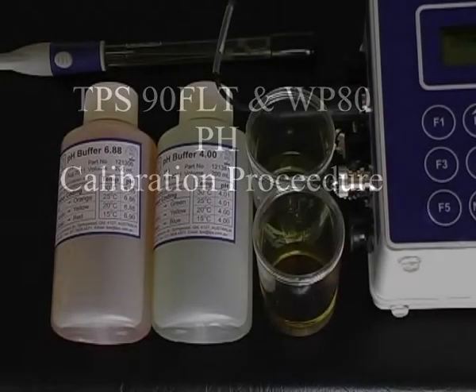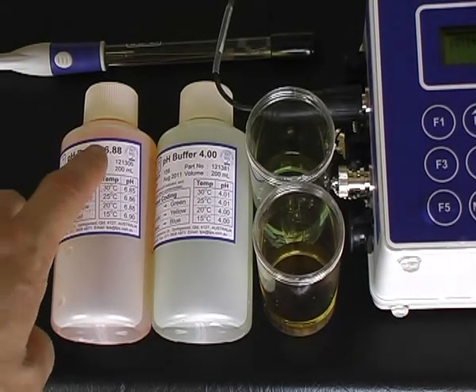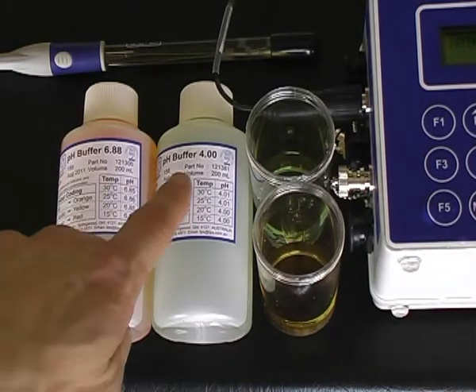The 90FLT is supplied with calibration solutions. Here, to calibrate the pH, two calibration solutions have been provided: a pH 6.88 and a pH 4.